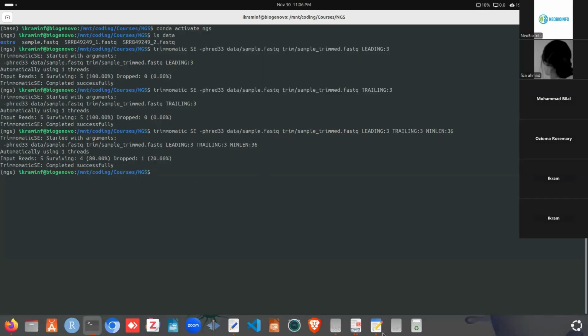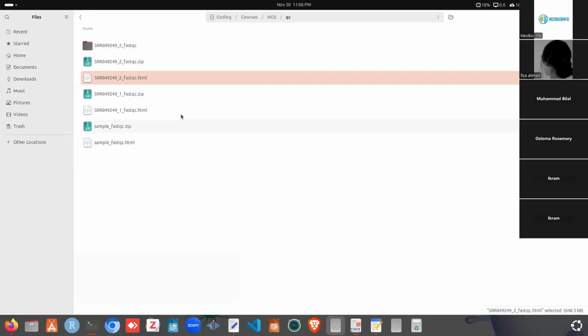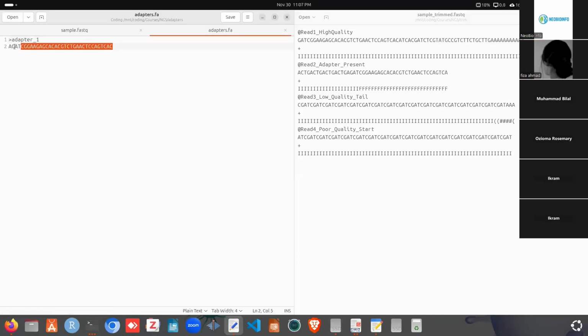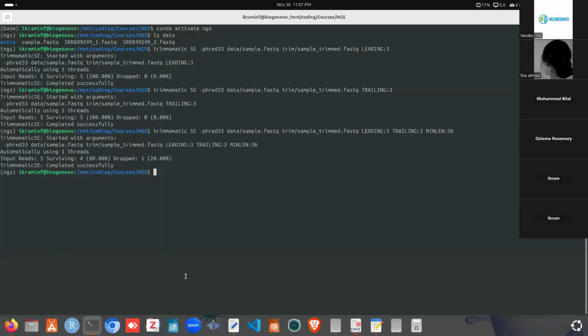How can we remove the adapter content? For this sample, we have one adapter. If we look inside our adapter file, adapters.fa, this adapter appeared in this sample.fastq. If we search for it, we can see the exact match of this adapter sequence, and other reads may also contain this adapter sequence. An adapter sequence may have an exact match, may have a few mismatches with the read, and it may also have only a partial match. So now we can proceed with how we can remove that.